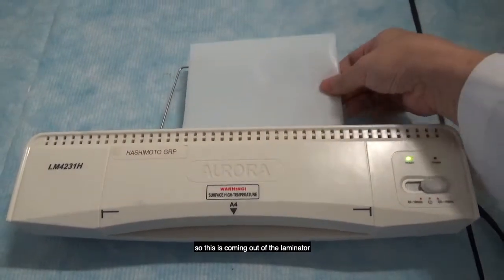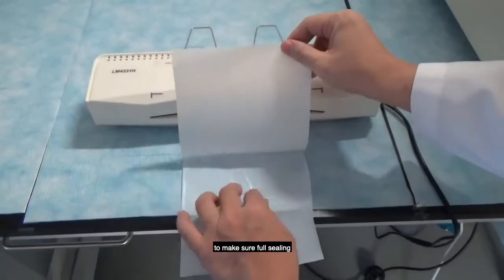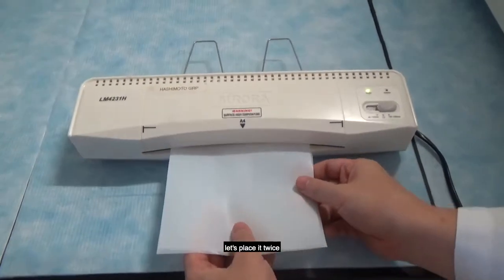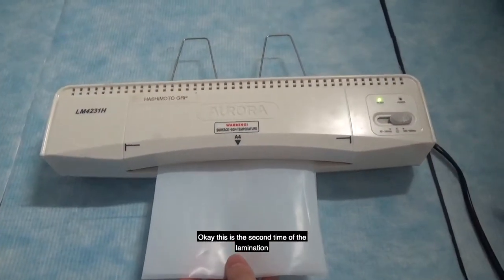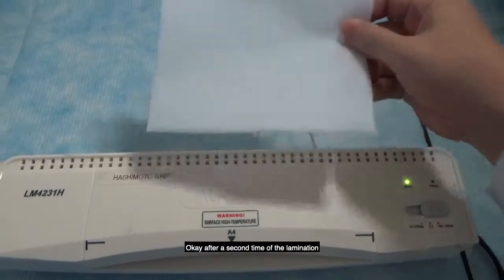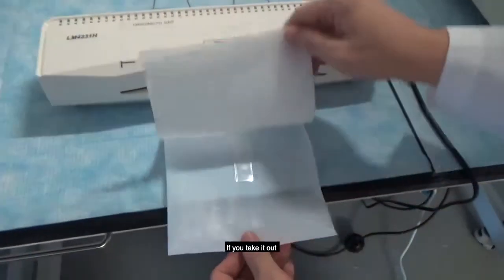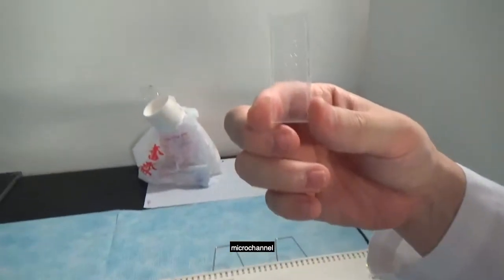Okay, so this is coming out of the laminator. Let's make sure of the sealing. Let's place it twice. This is the second time of the lamination. Okay, after the second lamination, if you take it out, you do have a microchannel.